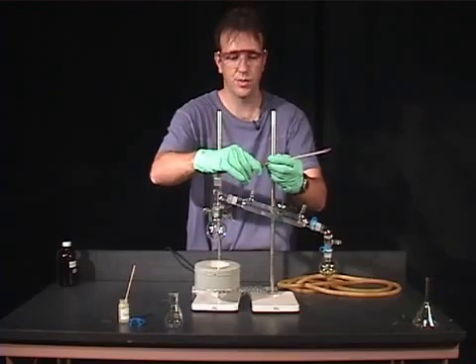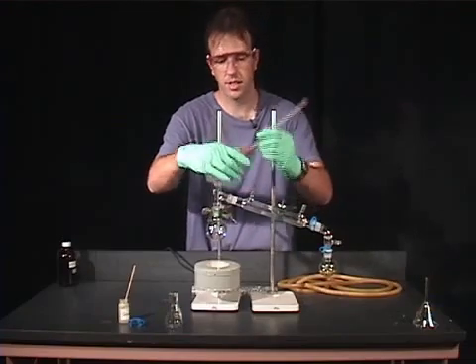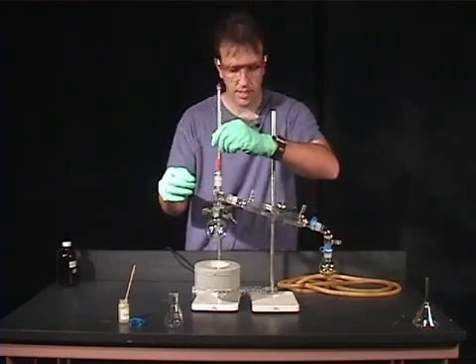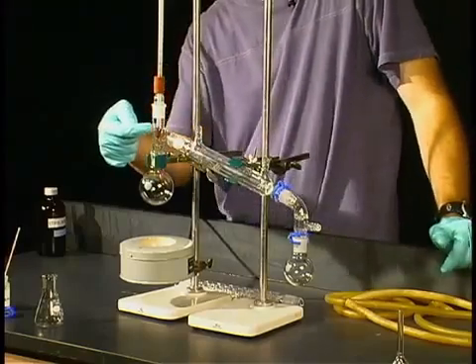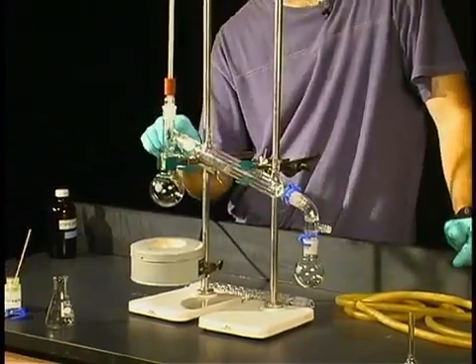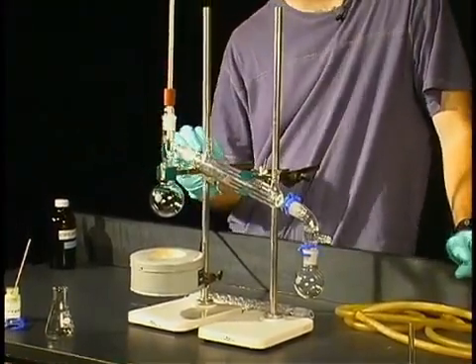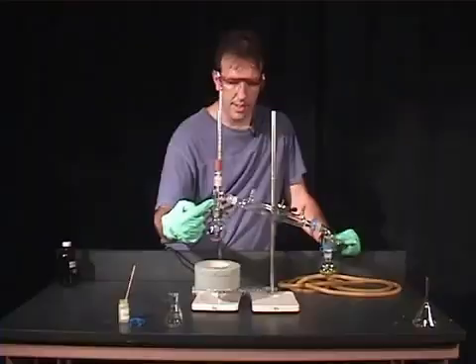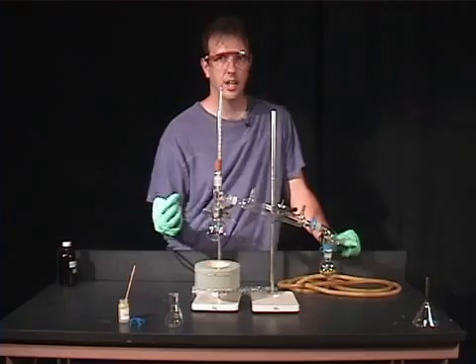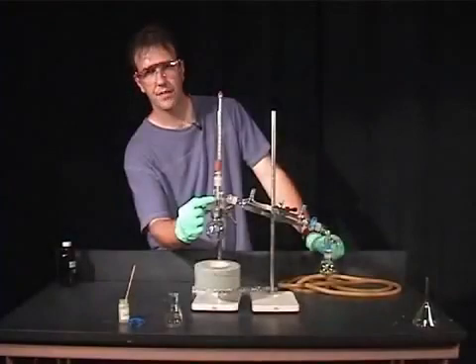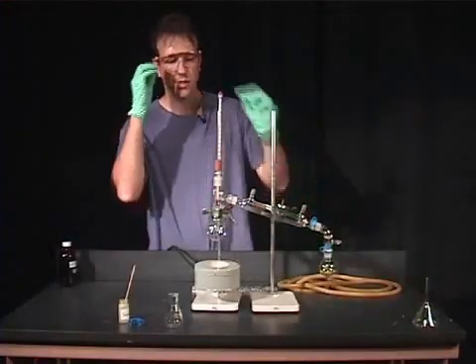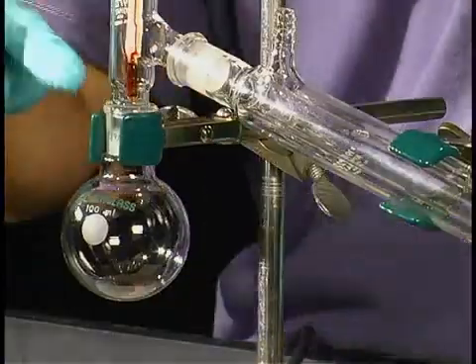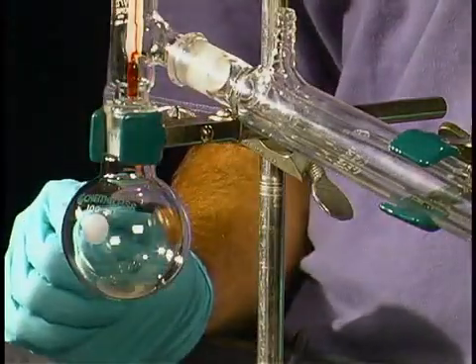So we put this in there. I probably put that in way too far. I'm going to move this out a little bit. So now we can set this in there. And you want to adjust this thermometer bulb so that the top of the thermometer bulb, the top of the red portion of this thermometer, lies right at the joint of this sidearm adapter. The top of the red portion of the thermometer is exactly in line with this sidearm adapter.